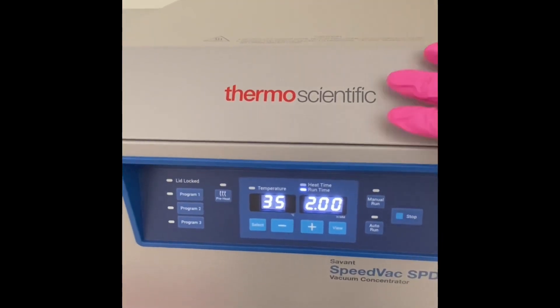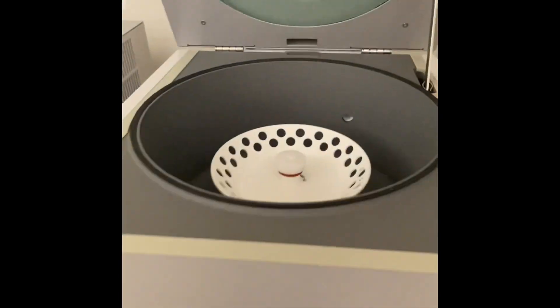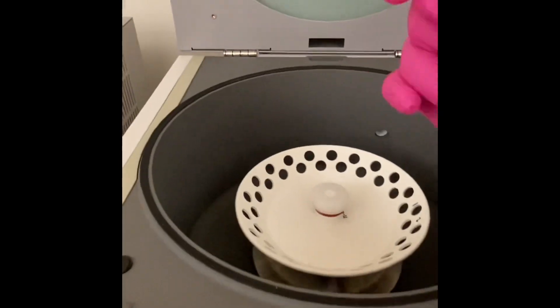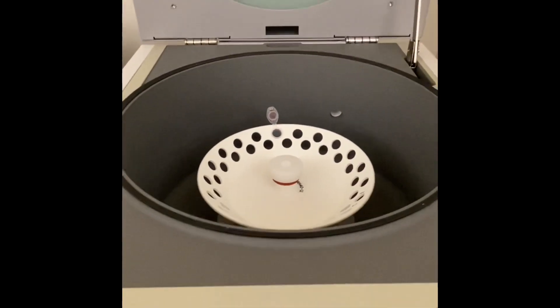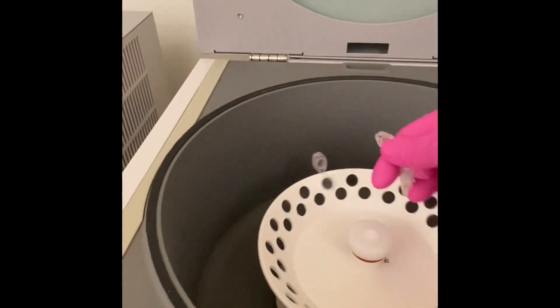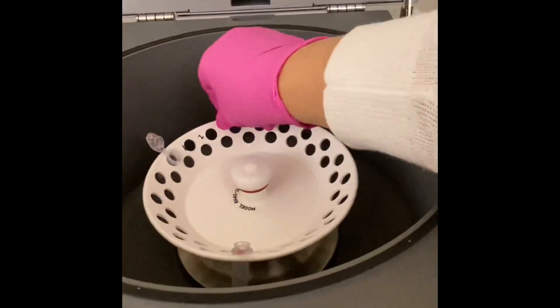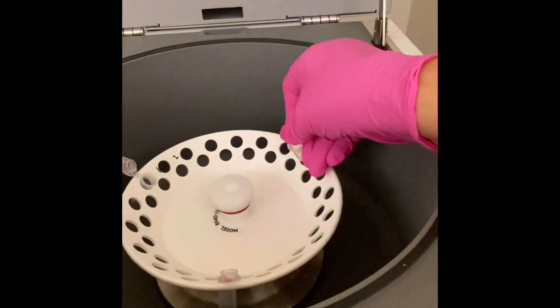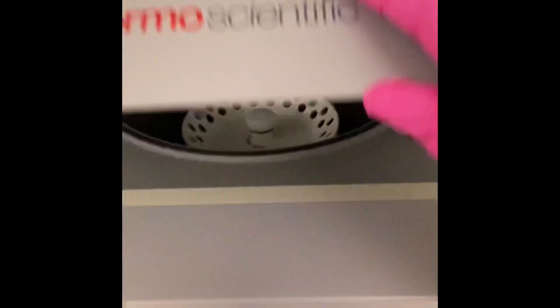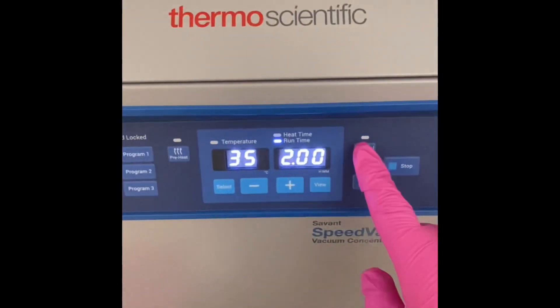So the next day—this is day three of our protocol—I will be taking my samples to the speed-vac. What I want to do here is just eliminate and get rid of the liquid part because I don't want it. I just want my peptide pellet, and then I will go from there.